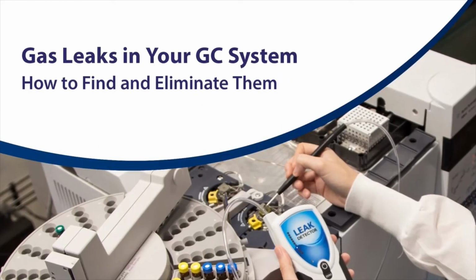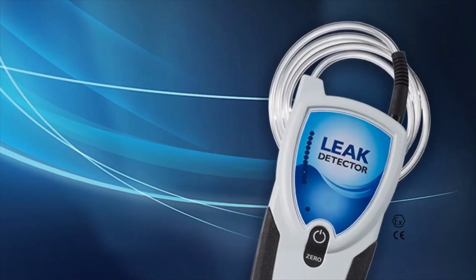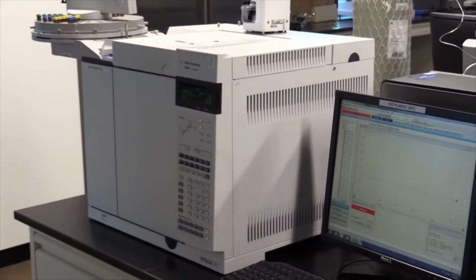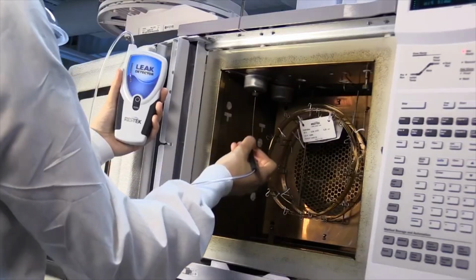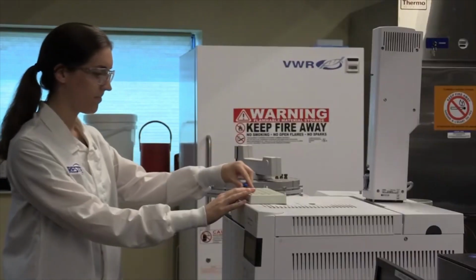Gas leaks in your GC system, how to find and eliminate them. Featuring the Restek Electronic Leak Detector. Even a small leak in your GC or gas lines can result in the loss of sensitivity, sample, and valuable high-purity gas. A leak can also damage your column and instrumentation as well as contaminate samples.